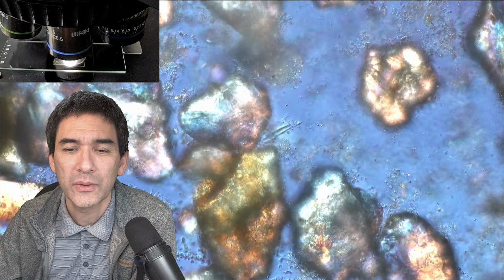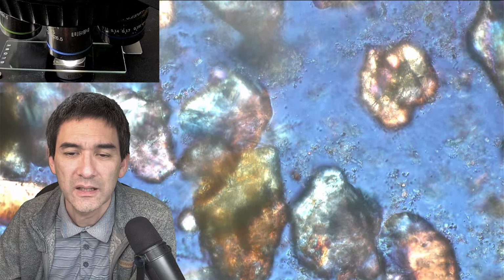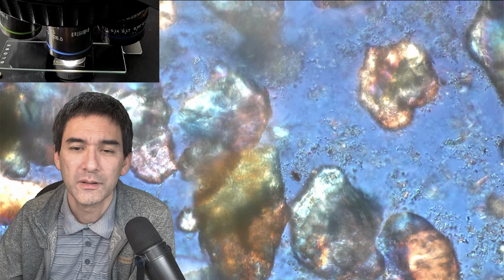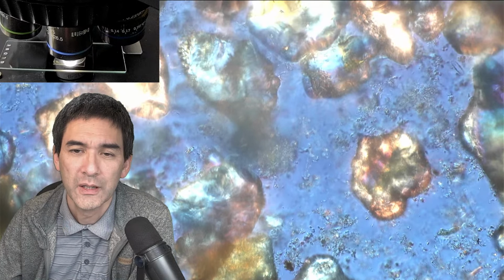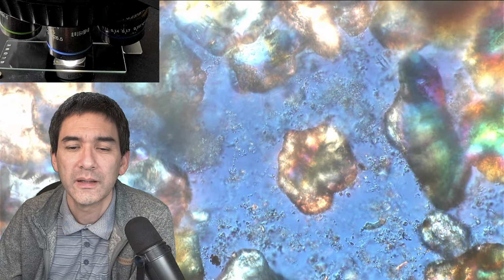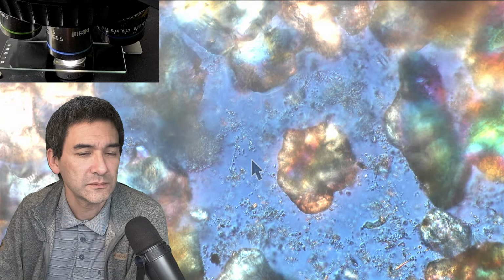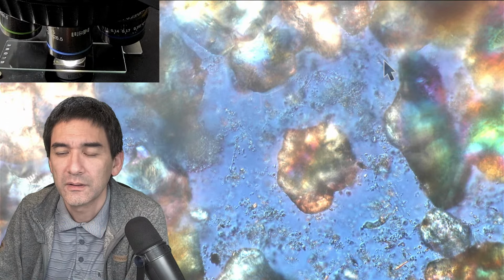You're going to see in the background occasionally some tiny dots wiggling around. That could be simply Brownian motion. It does not mean that these are cells that are moving. I don't know if you're able to see this also on YouTube. But this tiny wiggly motion of some of the dots in the background, that's Brownian motion. It's simply a random motion, but there is no active movement. And just to show you the diatoms, let me see. Yeah, this one is one. I'm going to turn on the arrow again. So this one is one, for example. This one over here could be one.